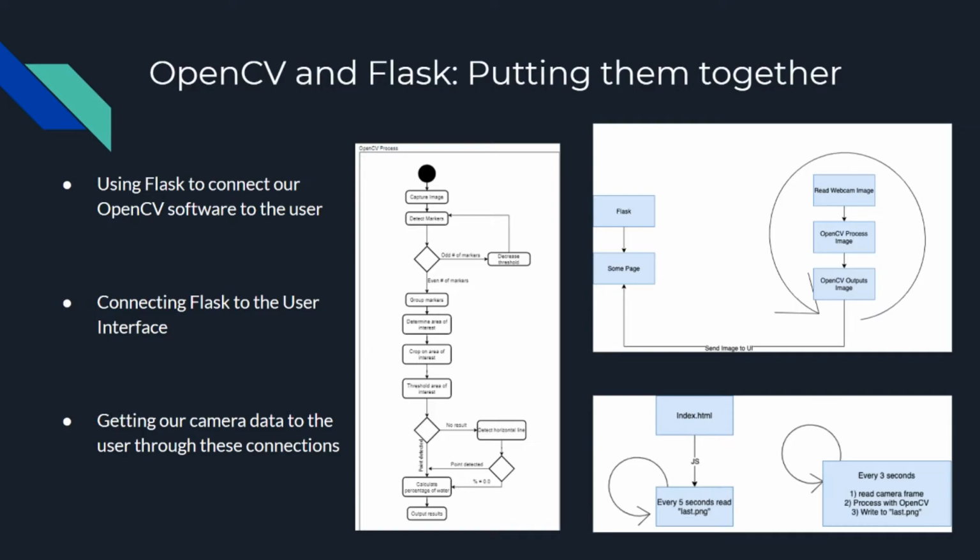In the far left image, you can see the process of OpenCV reading the information from the captured image of the camera to detect the levels of the water within the tubes that we are reading. Now, in the top right image, you can see the process of OpenCV reading that image, outputting the data that it receives from that image and the image itself, and sending that information over.